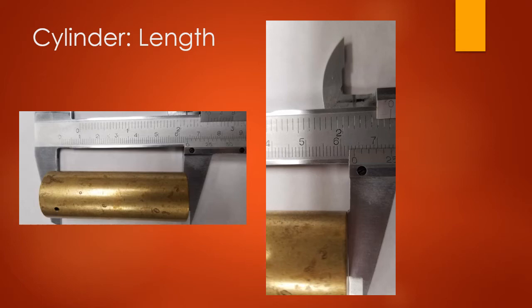So instead of using a plastic ruler, I used what's called a caliper because it's a little bit more accurate, especially when measuring things that are round. So what I have shown first is the length of the metal cylinder. And how you read a caliper, I have a close-up to the right here, is you see where this 0 is and that dash mark above the 0, that's where you're reading from. Okay, so you don't want to read along this edge right here because that's incorrect. You want to read from where this 0 dash is.